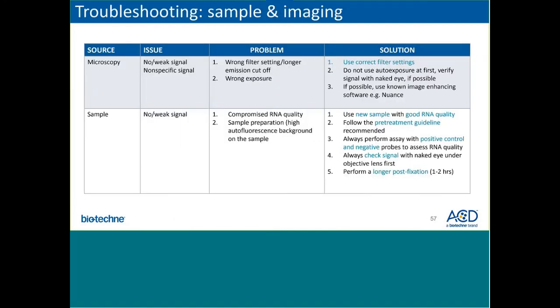Here are a couple of troubleshooting issues with regards to imaging with the fluorescent assay. This could mean you are using the incorrect filter setting, or perhaps doing a longer exposure, in which case you can use the correct filter settings based on the recommendations within our user manual. If possible, if you have an image enhancing software, this could also help to reduce some of the autofluorescence and high background. If you think that it's possibly due to compromised RNA quality or sample preparation, you can try and prepare your samples per our recommendations in our user manual. We would always suggest to perform your assay with the positive and negative controls, as this helps to best assess RNA quality.